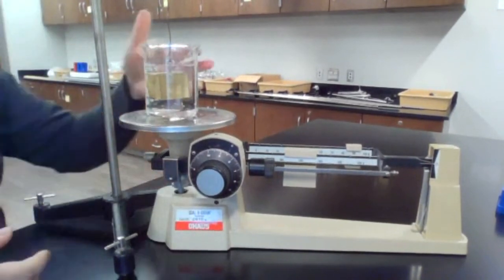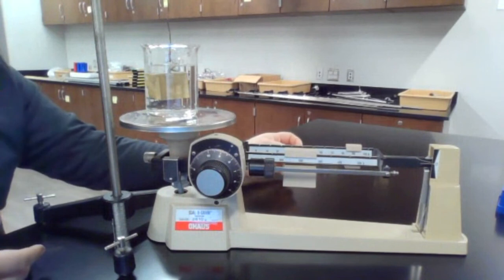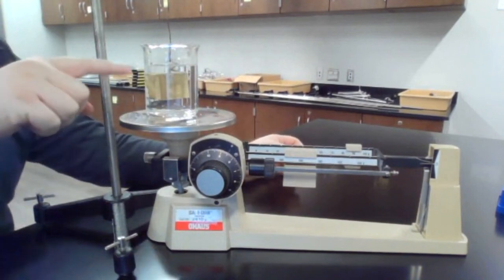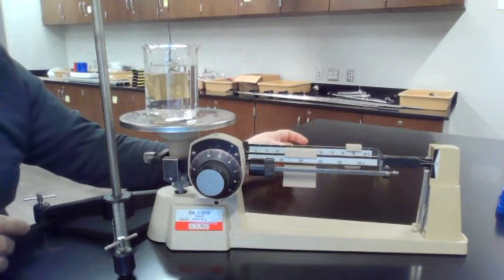All right, and so then the difference between those two masses, again, is the mass of the water, but because the density of the water is 1 gram per cubic centimeter, that's also the volume of the water displaced, and that's the same as the volume of the block. Okay. We're going to just assume that all of those metal blocks have the same volume, so you don't have to do this part multiple times, but you do have to find the individual mass of each of the blocks.